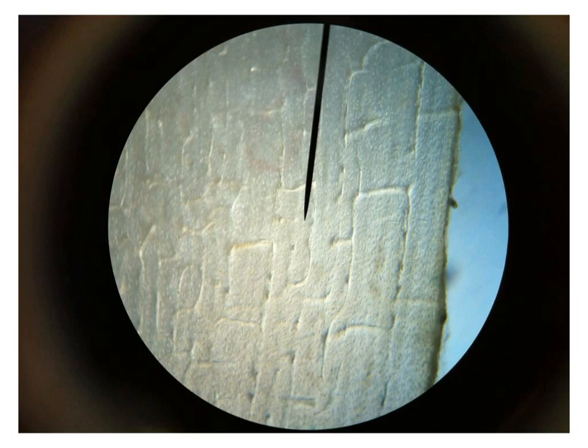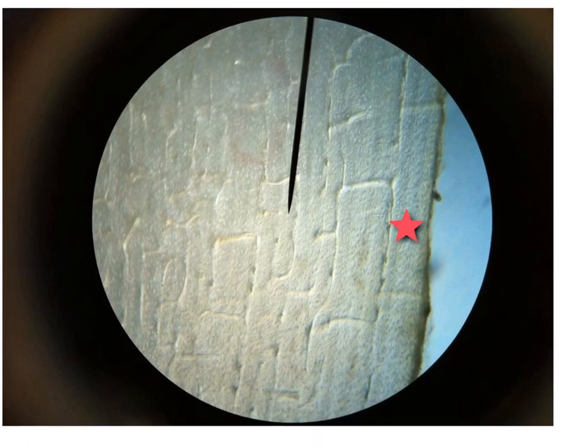Also, it is the ground compact bone, but here it is in the form of a longitudinal section, but you are not asked to mention the direction of the sectioning in this slide. It is characterized by being unstained, and as you see, you can diagnose the Haversian canals, and also the connecting canals formed of these Volkmann's canals connecting the Haversian canals together.